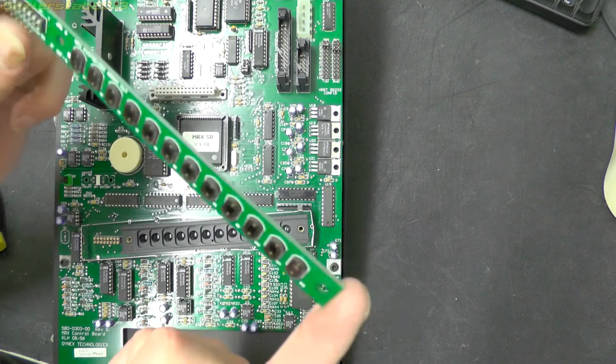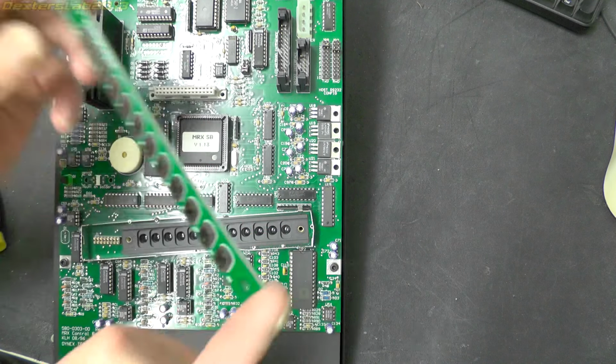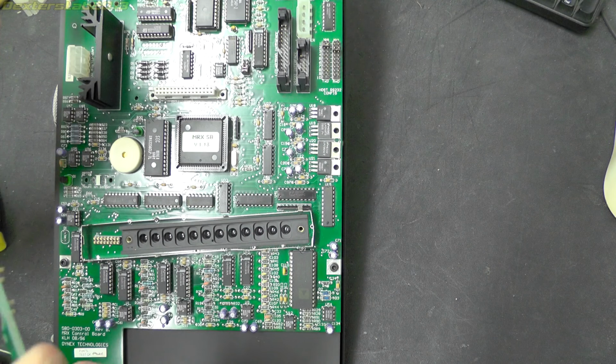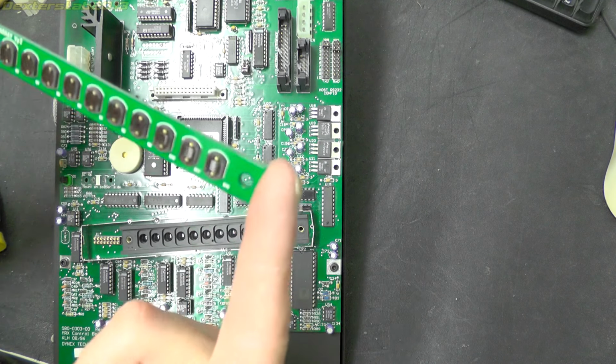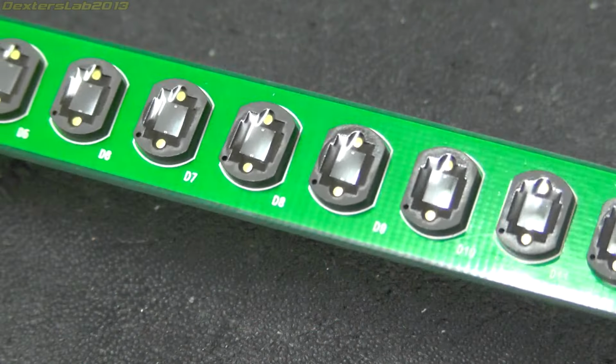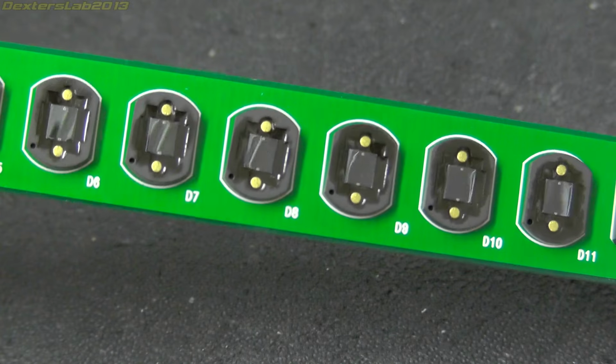Yes, indeed, there we have tiled on the PCB the photodiode array. So that pretty much answers that one. They look pretty cool looking photodiodes, to be fair. Let me just see if I can get you a closer view. Okay, so hopefully you can see those photodiodes there.